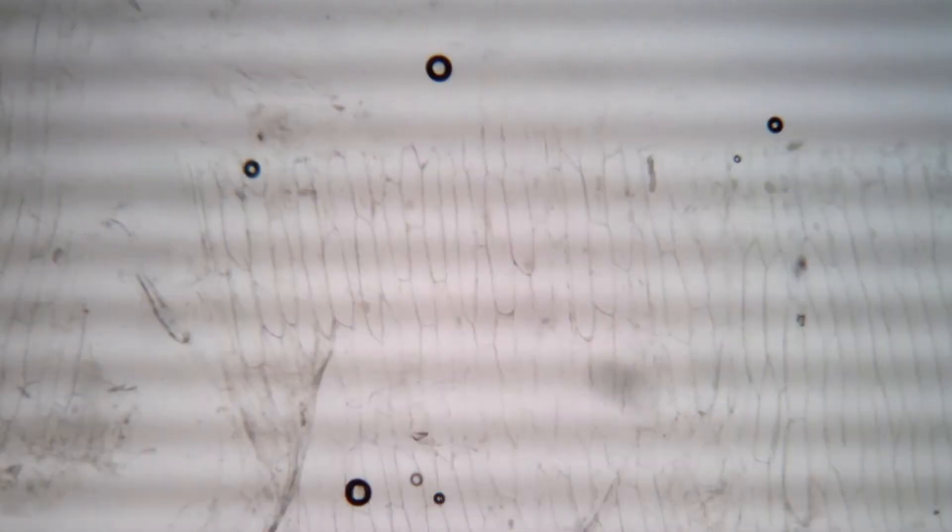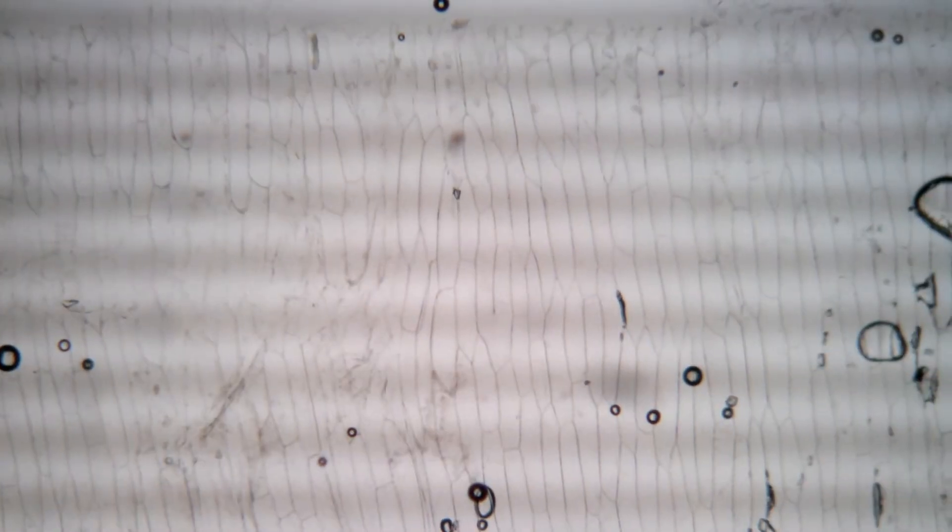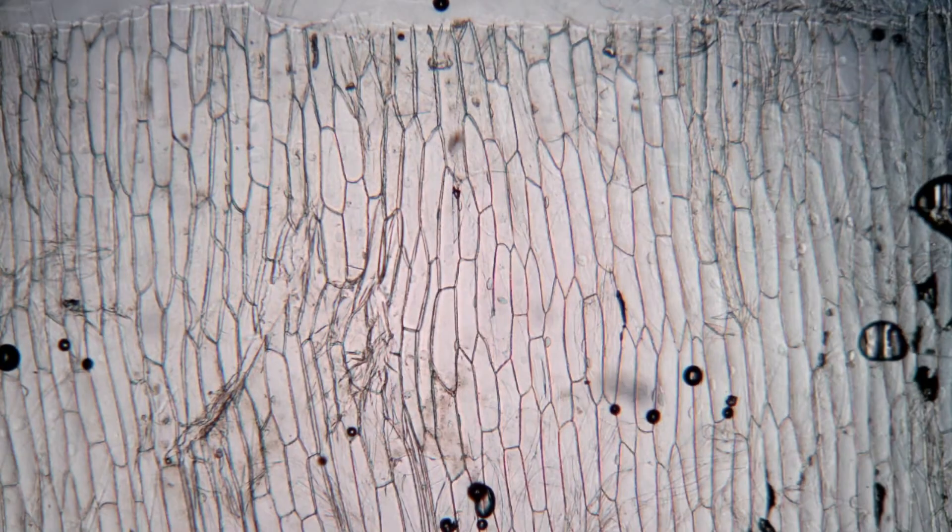Scan your slide under the 4x objective. Since the epidermal cells are transparent, you will need to close the iris diaphragm to see the cellular structures.